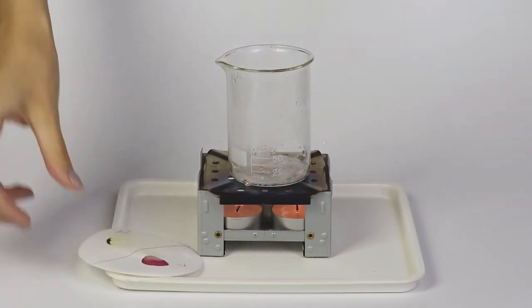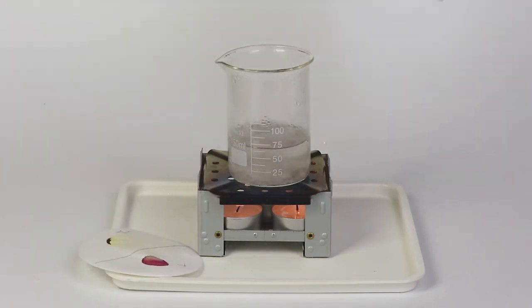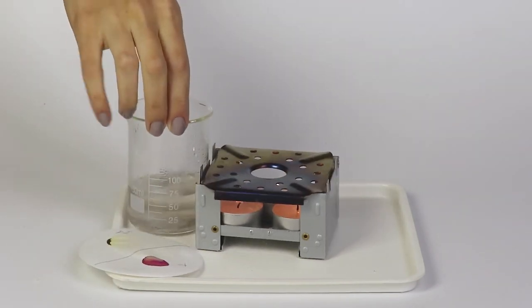After finishing the experiment, dilute the reaction mixture with an excess of water and then pour it down the sink.